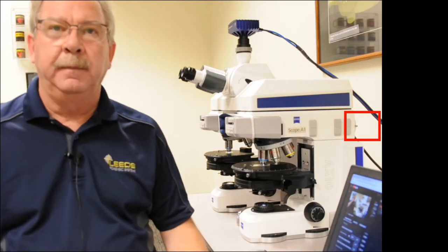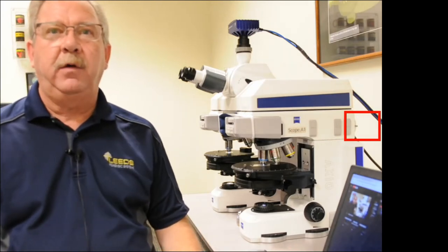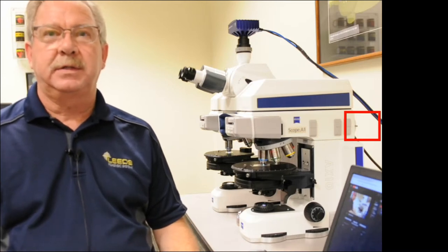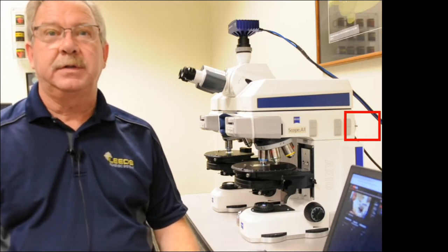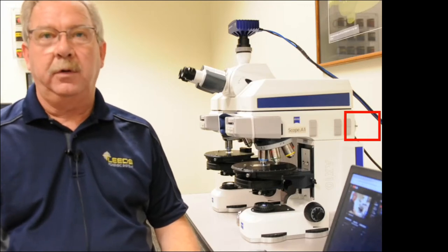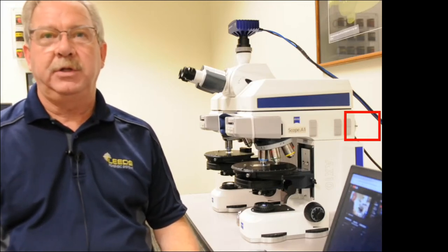This is Kevin from Leeds. Today on Leeds Helpful Tips, we're going to discuss interference figures and how we see them, or how we perform conoscopic imaging.